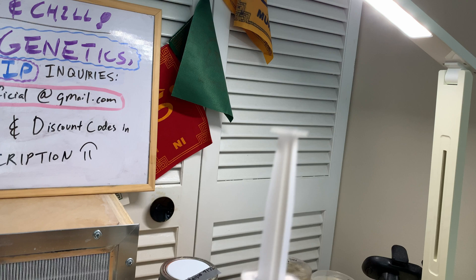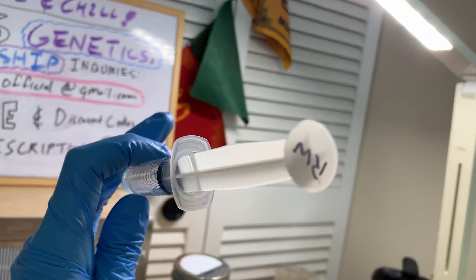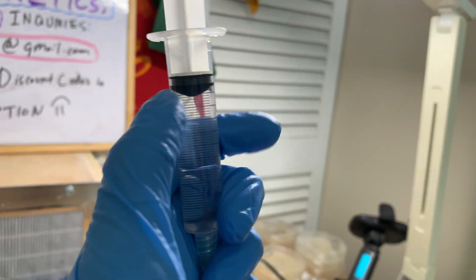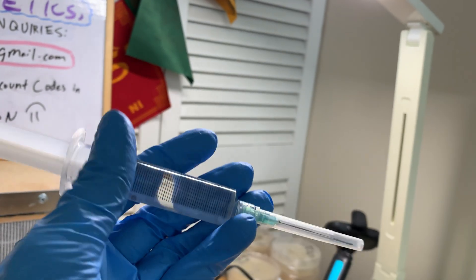This one is a rusty white variety, so the spores aren't as dark-colored and may be harder to see. But I usually aim for just maybe one little clump, small dots here and there — that's plenty. You don't need it to be very dark and just swirling around with spores.